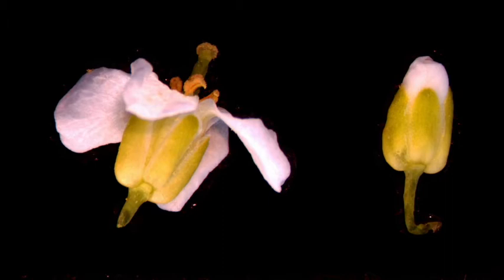There are four distinct sepals seen here in green-yellow, subtending the white petals. When we're dissecting flowers, the first step is to remove the sepals. You can think about it a little bit like peeling an onion — you're taking the outer skin off, and then you get to the goodies inside.